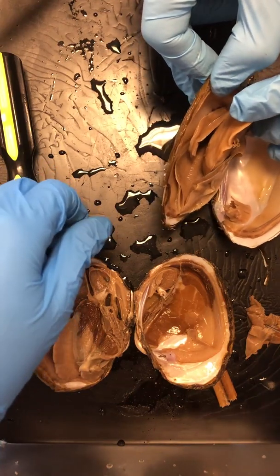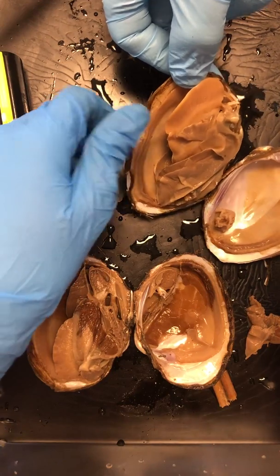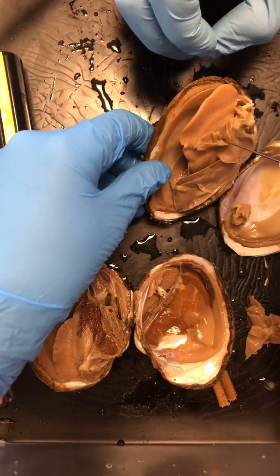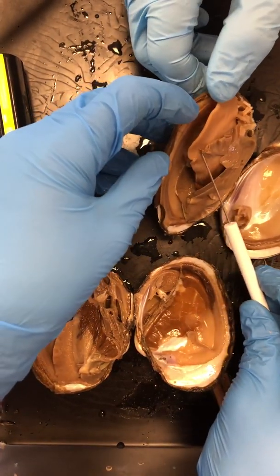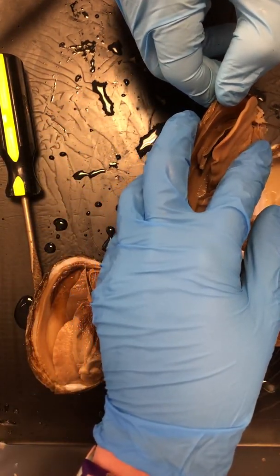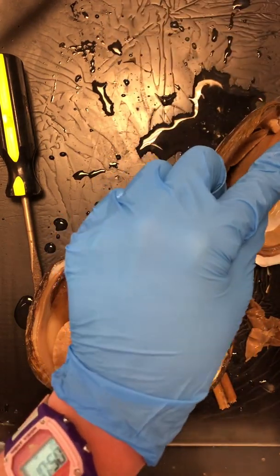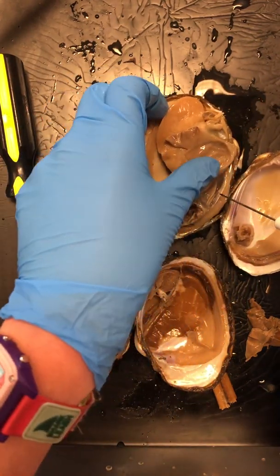Couple other cool parts for us. Let's see if we can find the mouth, which is going to be over this way. We're going to find what are called palps. And your palp is like a soft, oh, here's your palp right here. This palp's job is basically to funnel food into your mussel's mouth. And there's going to be like a little hole, that's part of our mussel. Here's our foot. Where's our mouth? Here's the intestine.